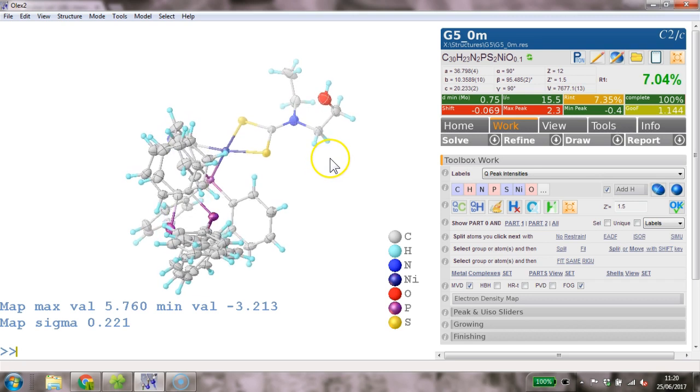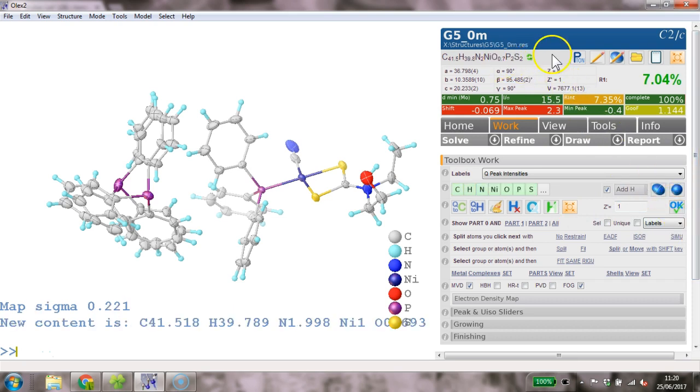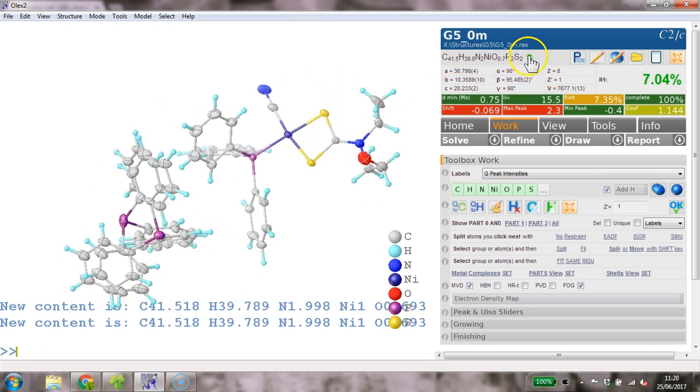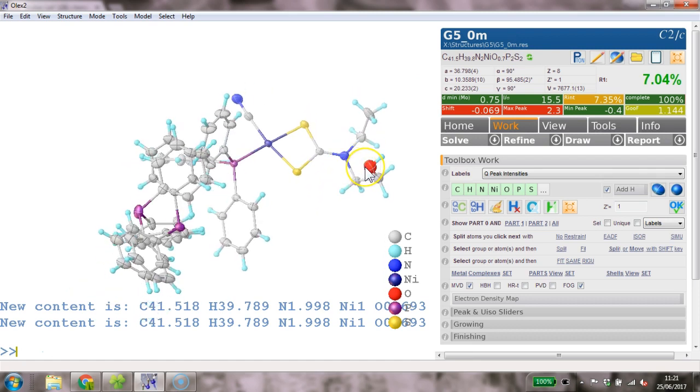And over here, I think this is not such a bad model. So the next thing that remains to be done is to adjust the formula. So for some reason this has been set to 1.5, but that really is 1. So we hit the OK button, and sorry, up here, and that should adjust the formula according to what's on the screen. So something isn't quite right. I wonder what I've done before here.